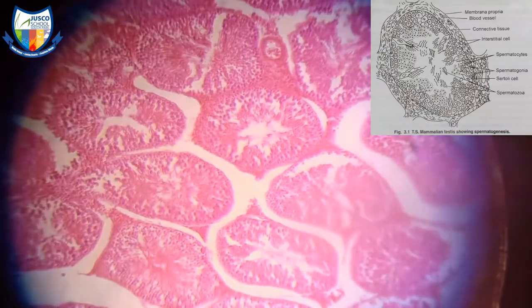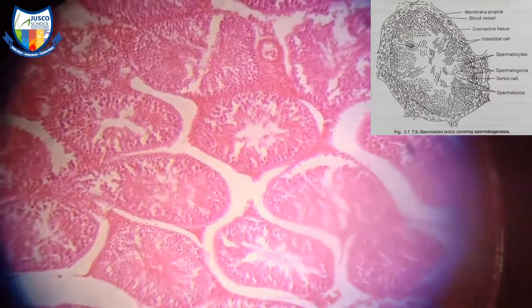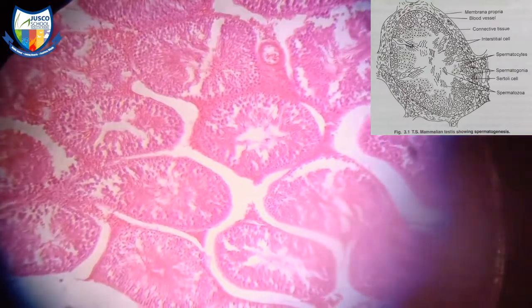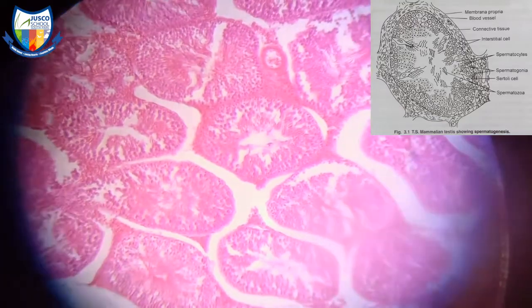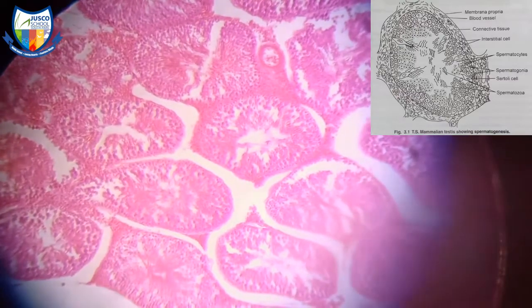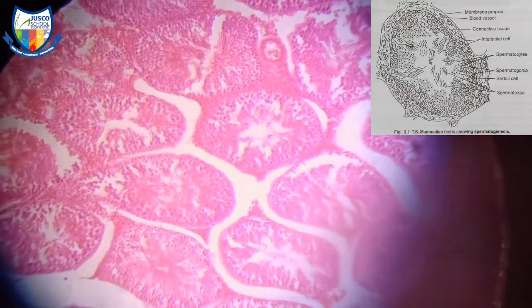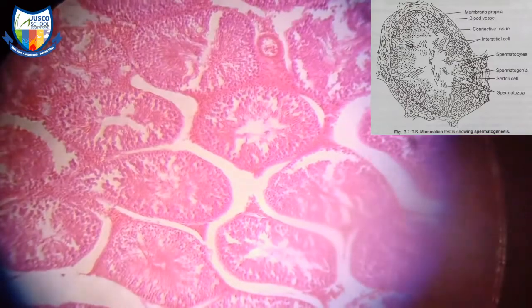Remember the important function of Leydig cells. These Leydig cells are very important for the production of a male hormone called as testosterone. Now, this germinal epithelium consists of two cells: one is spermatogenic cell and another is Sertoli cells. Sertoli cells are the supporting cells and they help to nourish the sperm. That is why they are called as mother cells. The round structures at the corner of the seminiferous tubule contain spermatogonia, and their various stages of development are seen towards the lumen.